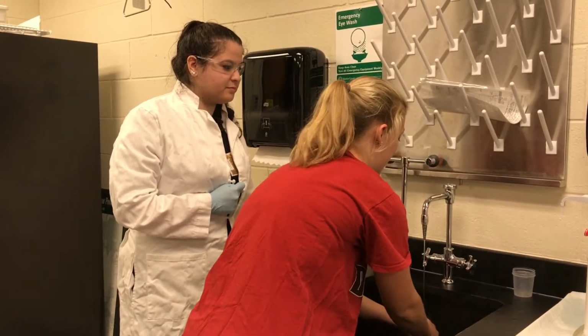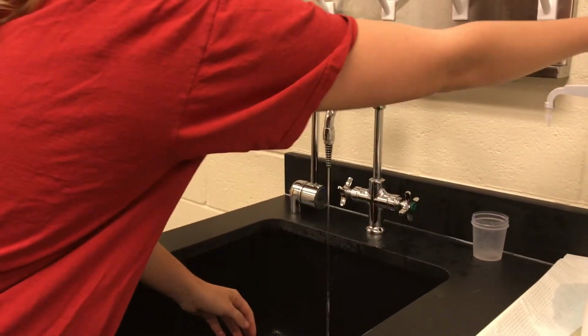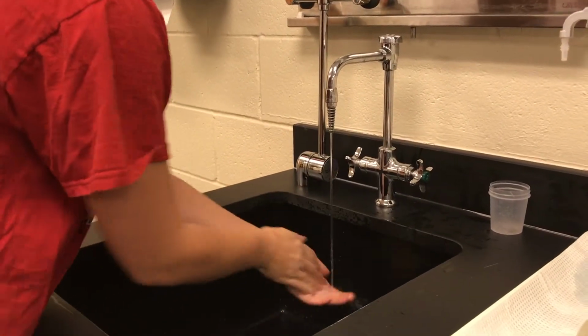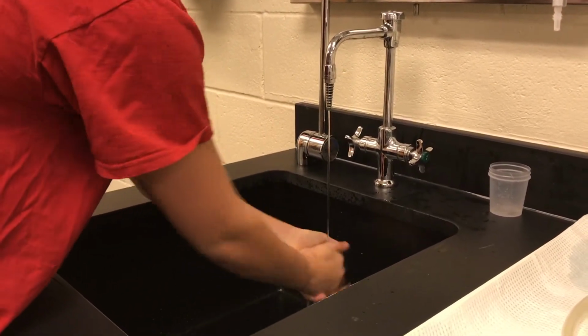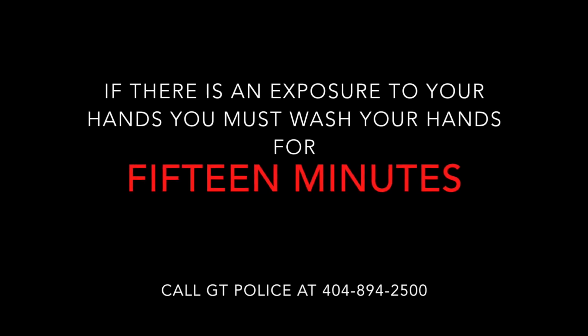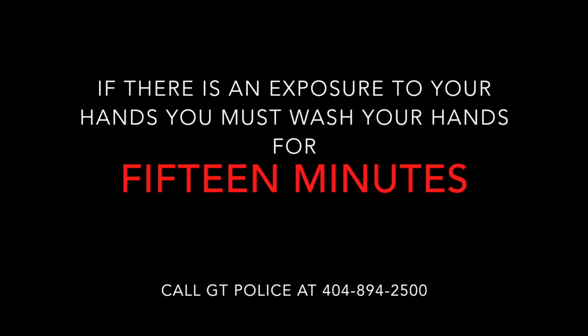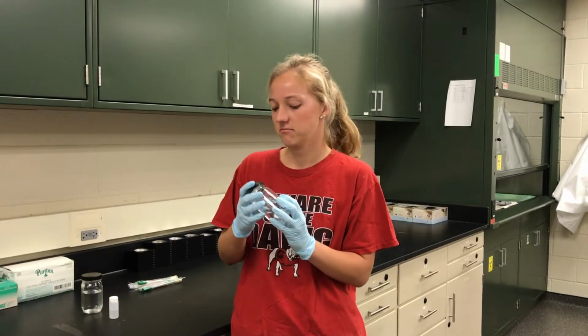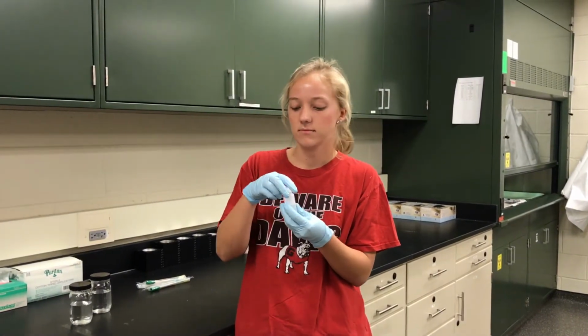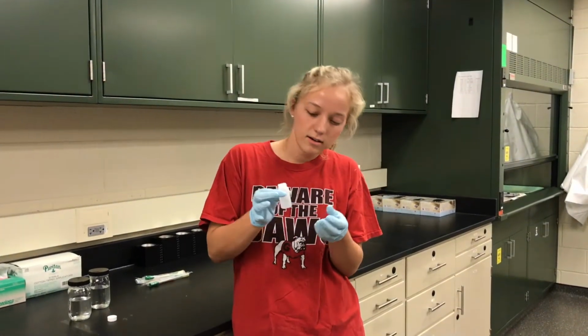Has it been 15 minutes yet? Not yet, keep going. Have someone call GT Police to report the accident. Make sure the victim washes their hands with soap for 15 minutes. If the victim knows what chemical they were exposed to, 4 copies of the SDS sheet for that chemical need to be printed out. Well, thanks to our kind tech student, Alexis, Marianne now knows how to respond if she spills chemicals on her hands, but she still has more to learn.